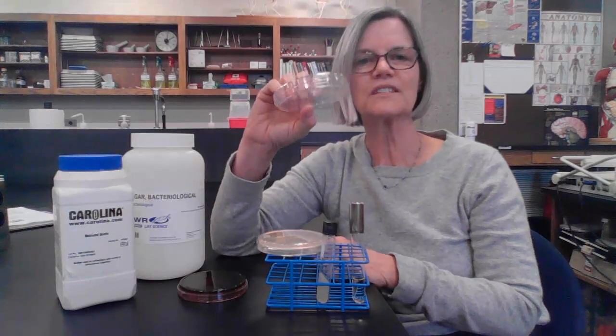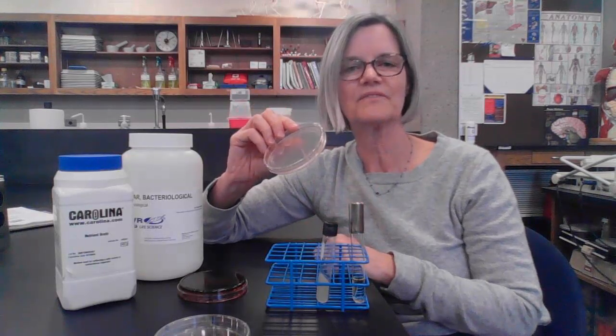So petri plates have become a really standard tool in the microbiology lab. Originally, people used glass petri plates. More commonly today, like everything, we use plastic ones that when you purchase them, they come pre-sterilized. So this is free of microorganisms, and what I can do is I can make some of this nutrient agar, sterilize it, and pour it into the petri plate, and then let it cool, and I'll end up with an agar plate. So this one, the media in here happens to be nutrient agar.